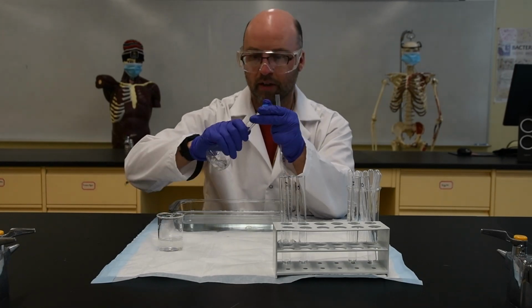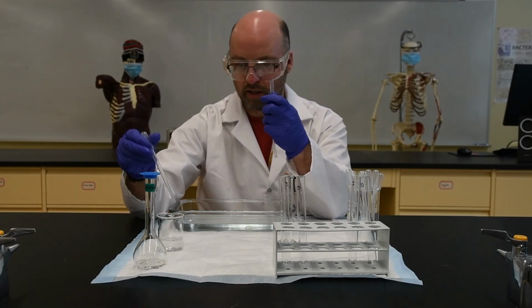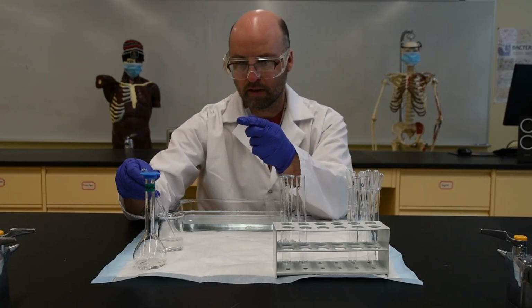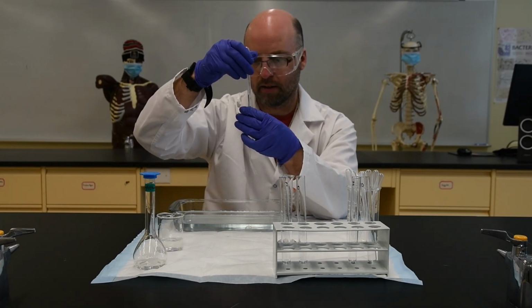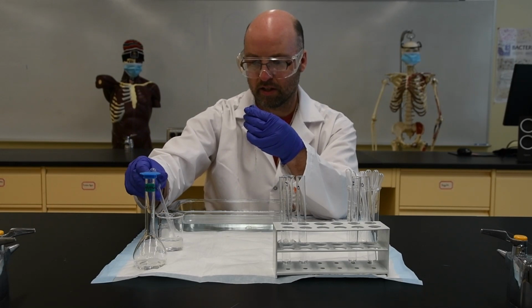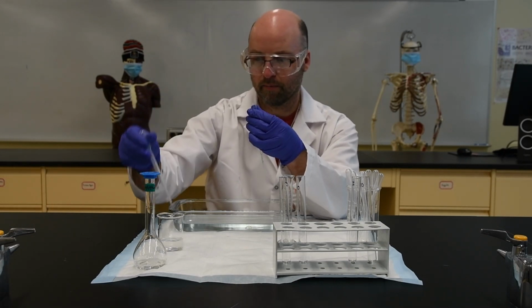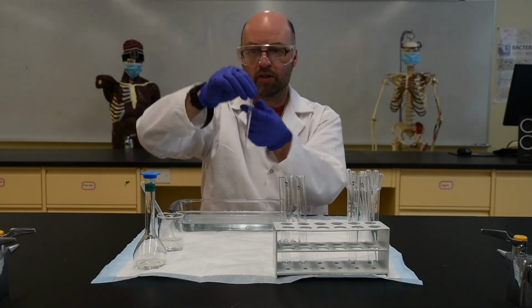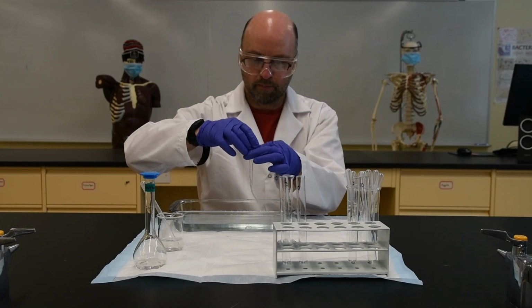I'm just going to put that in there just to make it a bit easier. Take some of this. Just be careful to add it to the inside of the bag. There we are. Maybe add just a tiny amount more. Good. And what I'm going to do is seal this end. I'm going to knot this end as well.